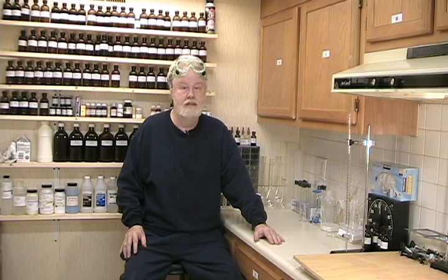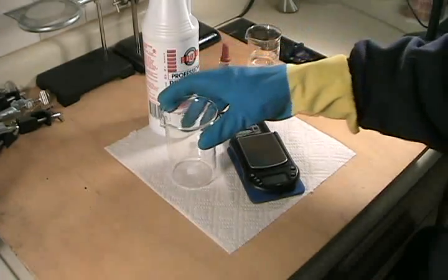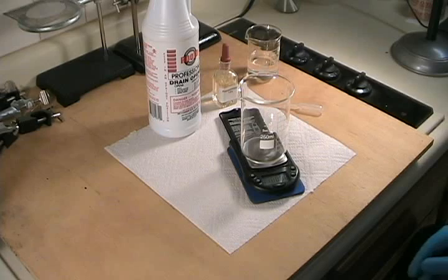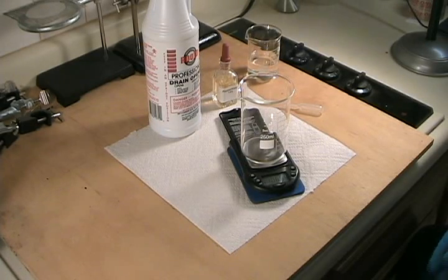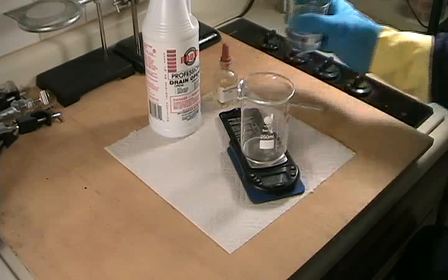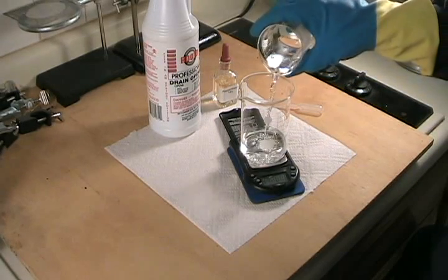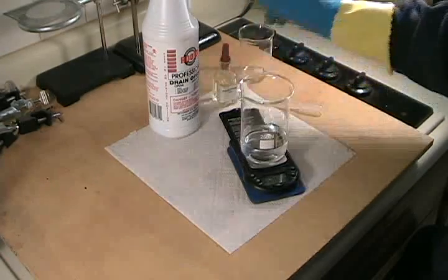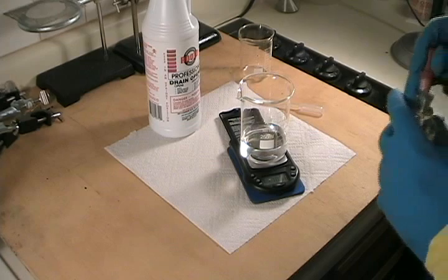We'll also save the sodium sulfate for later use. The first step is to determine the mass of a clean, dry beaker and record it. Our beaker weighs 106.54 grams. Now I'm going to transfer about 75 mL of water to the beaker and add a drop or two of phenolphthalein solution.